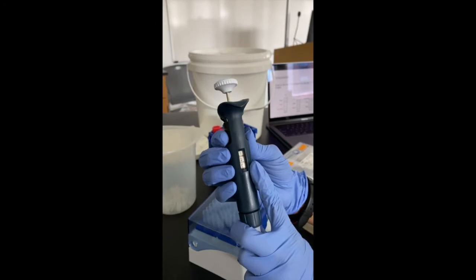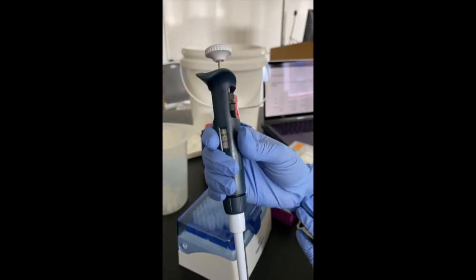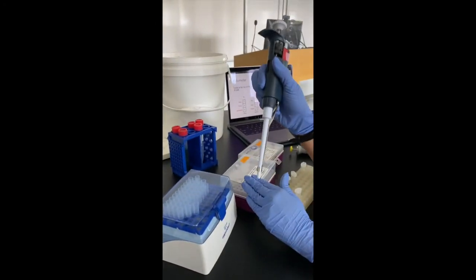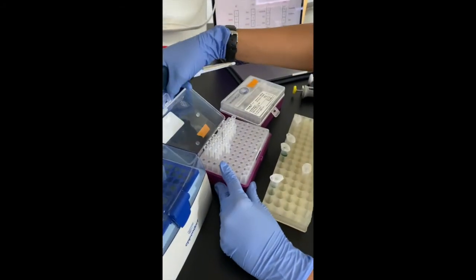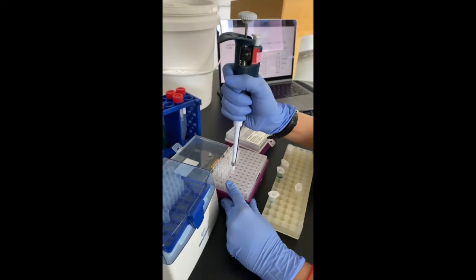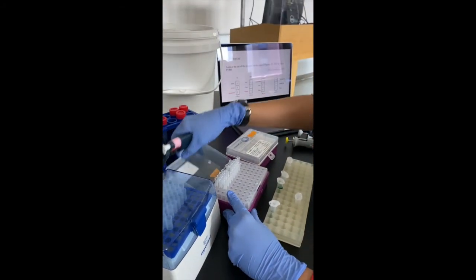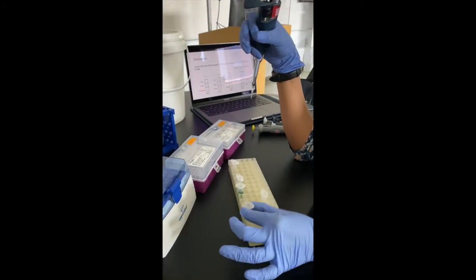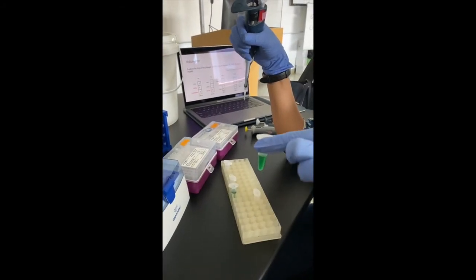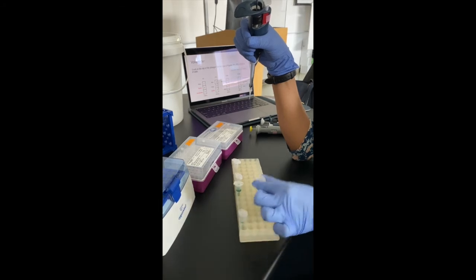So you've set the desired volume, you've chosen the right pipette. You know that for P200, you choose the medium sized tips. So once you've identified the tips, insert a tip onto the micropipette, close the tip box, and the task at hand right now is to aspirate 120 microliters of this liquid from this tube into this tube.